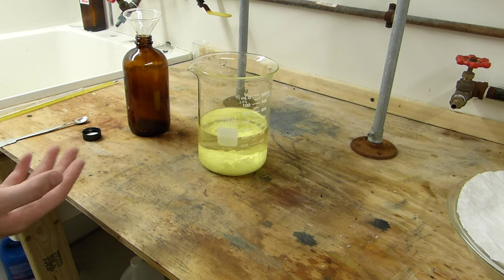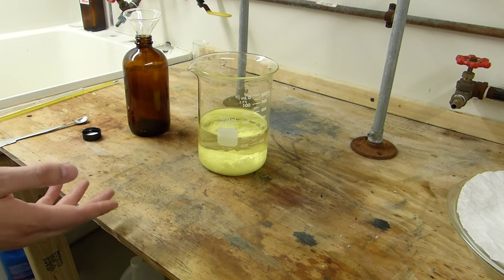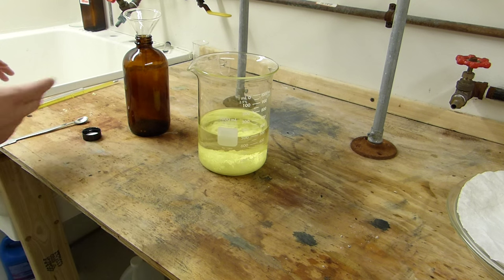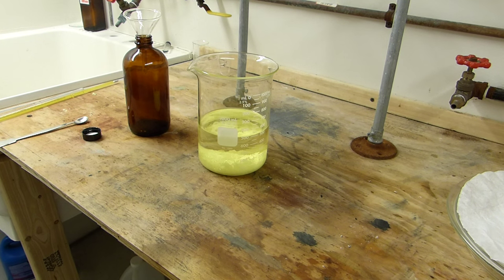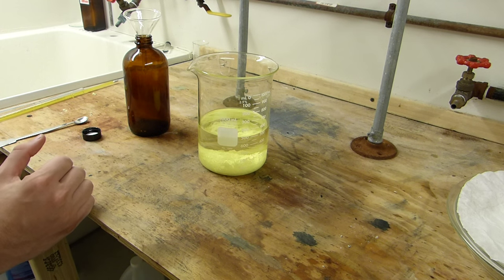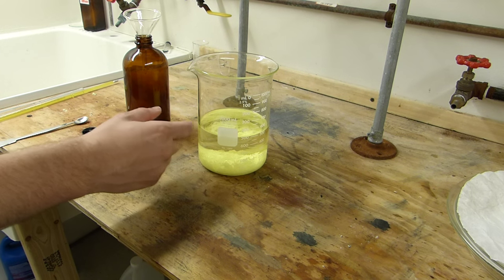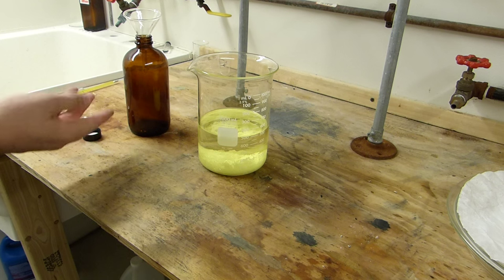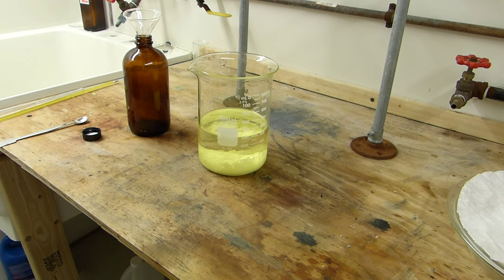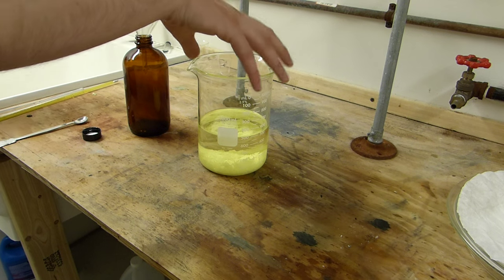You can also distill the xylenes if you want to remove the rest of the sulfur and recover them completely. But since I tend to recrystallize sulfur before I use any at any given time in the lab, especially since now I have a large amount of technical grade sulfur, I'm simply just going to keep the solvent in a bottle so it'll be handy next time I need to recrystallize some sulfur and I don't have to bother with the distillation. So I'll pour them off right now.